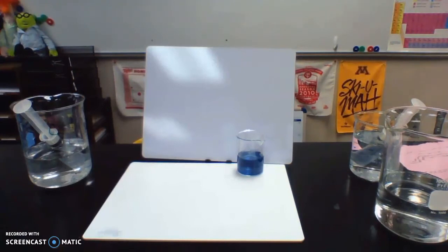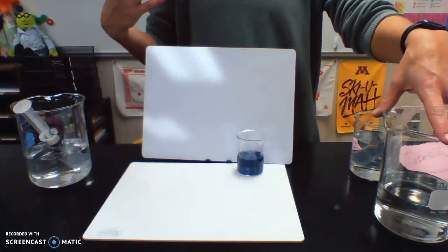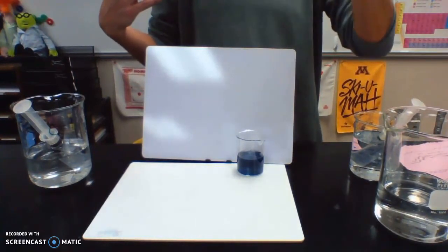There we go. It took even longer. So as we dilute A, it seems to take longer and longer for the reaction to happen.